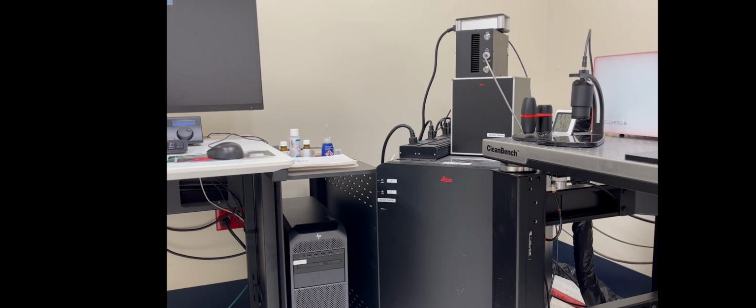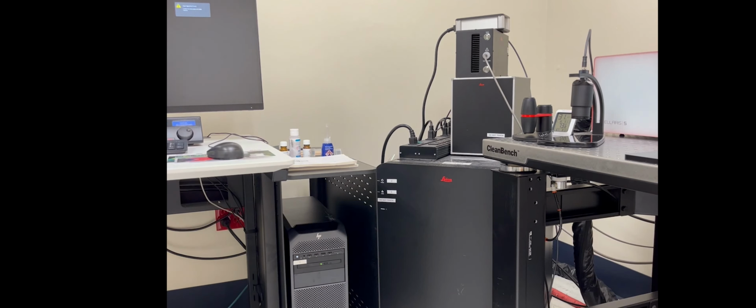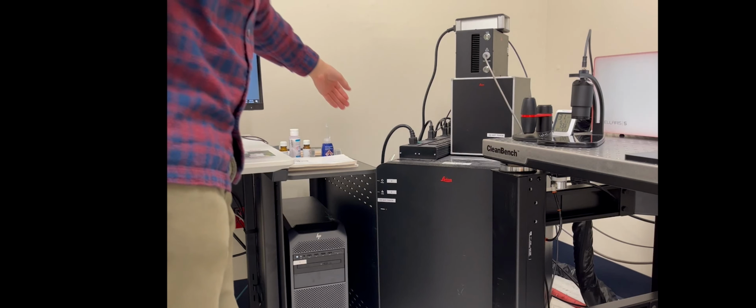There's only 4 things to turn on, and they're labeled 1, 2, 3, and 4, obviously. And the first thing is the computer. So I'm just going to turn on the computer now. And I usually just wait until that boots up into Windows before I do anything else. And so that's going to take a minute, so we might just jump ahead. And as you can see, we're booted up into Windows in the corner there.